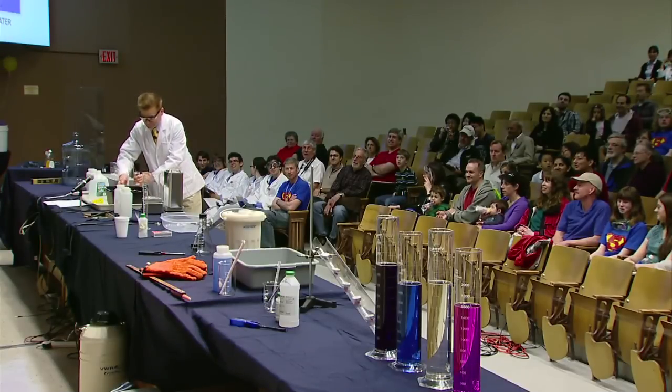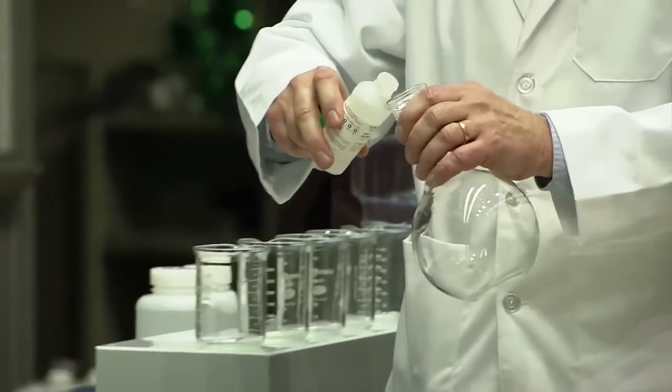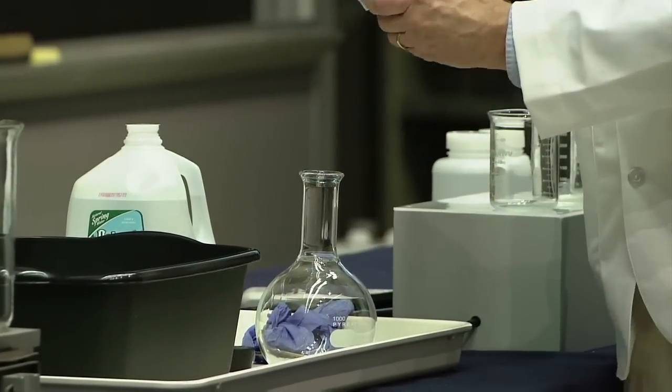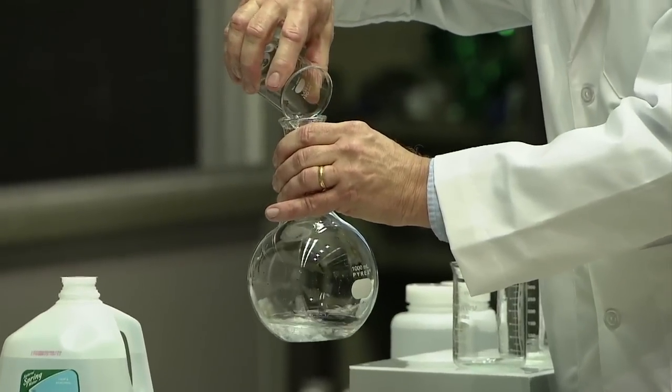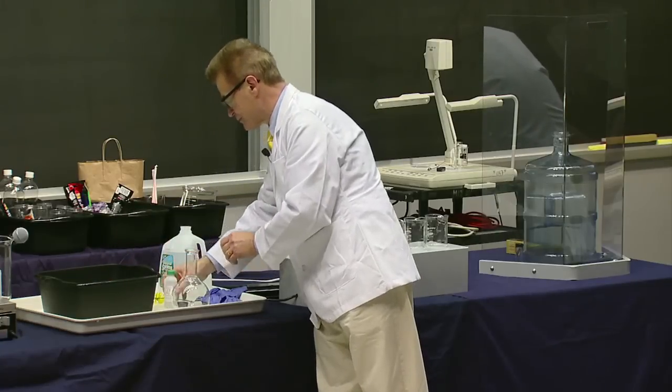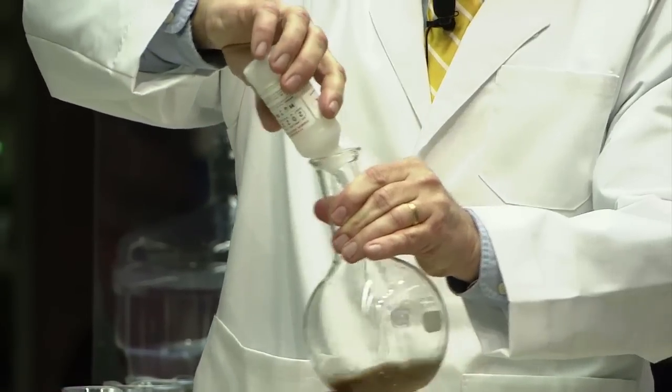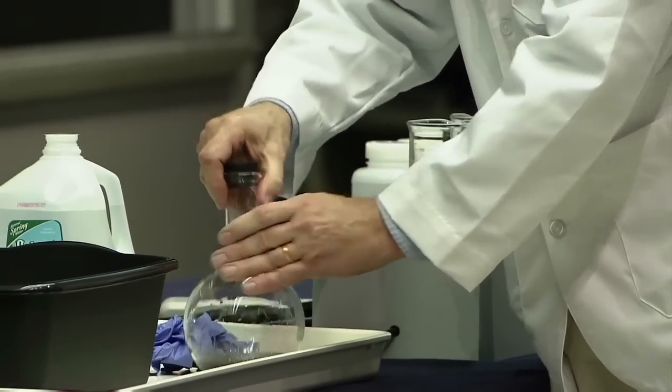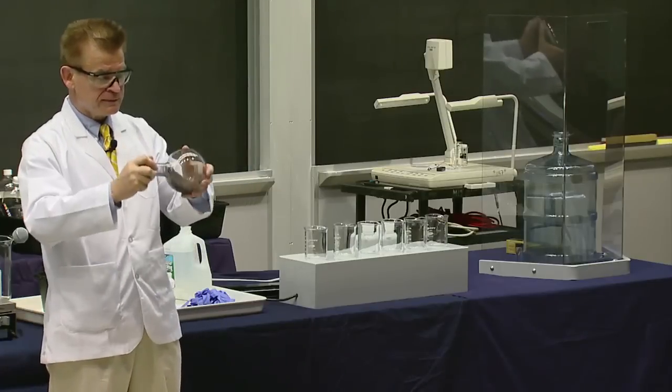OK, so I'm going to be careful, and I'm going to pour my first substance into the flask. My second substance down to the last drop. And my third substance. And if we're going to do a little shaking, we're mixing some things together.